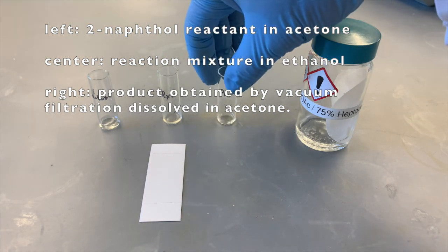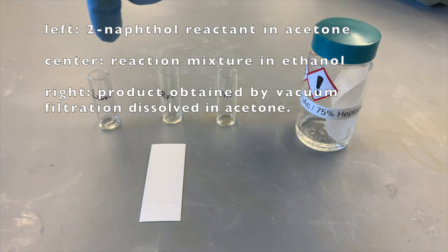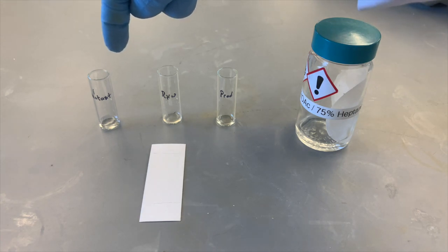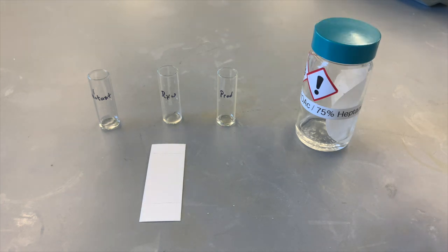And over here, this is the product that I obtained from the top of the Buchner funnel. So by comparing these, we will be able to see how far the reaction went at this point, how much of the starting material, the reactant, is left, and then based on how this spot looks, we will be able to tell if our product is a pure product or if it still retains some of the original reactant.